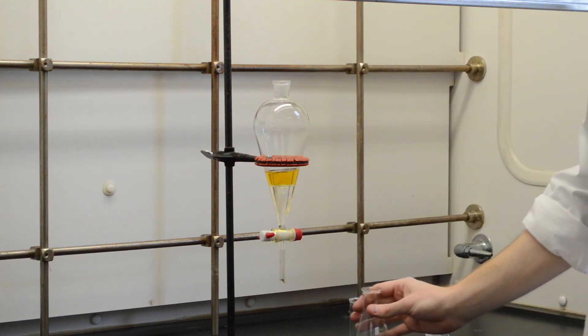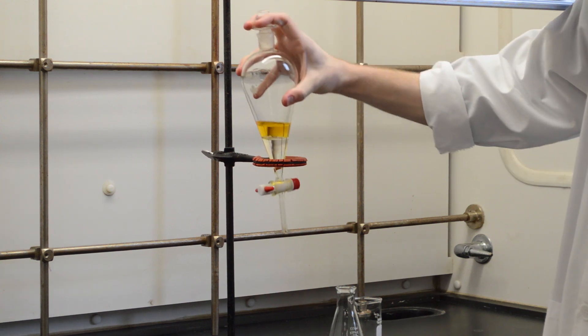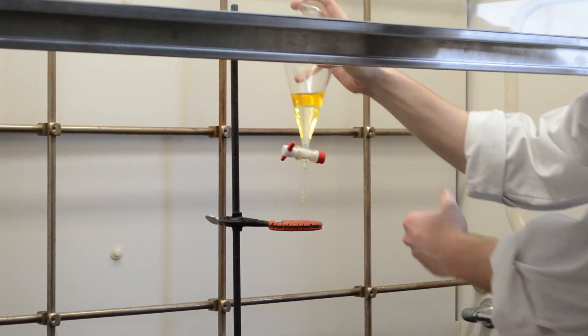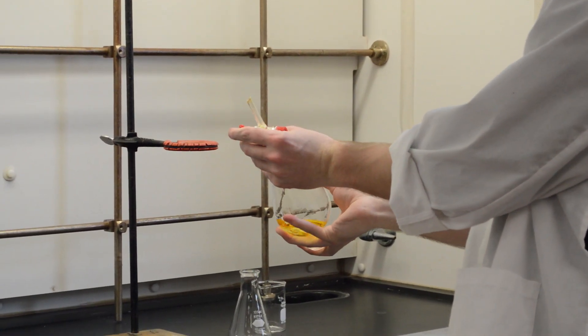You'll see right away that they've started to form layers. Next we want to cap this and start mixing. When you do mix these two products they create an amount of gas, so you want to vent this right away initially.